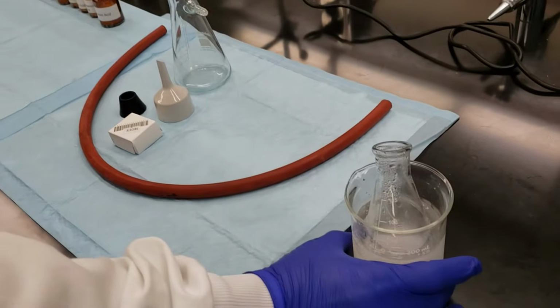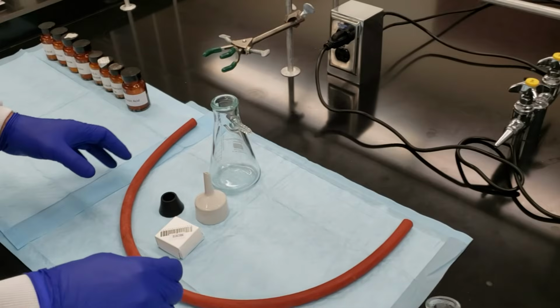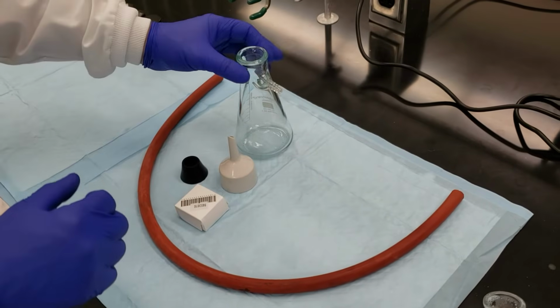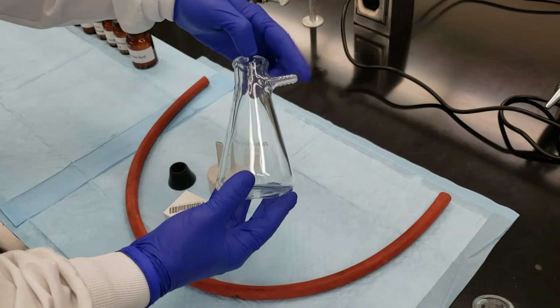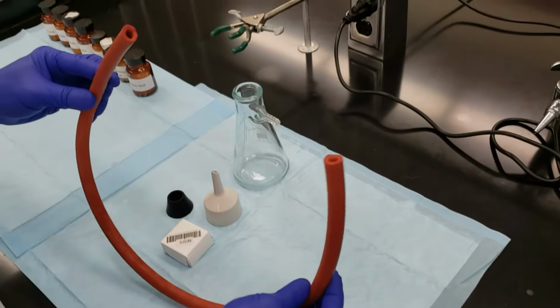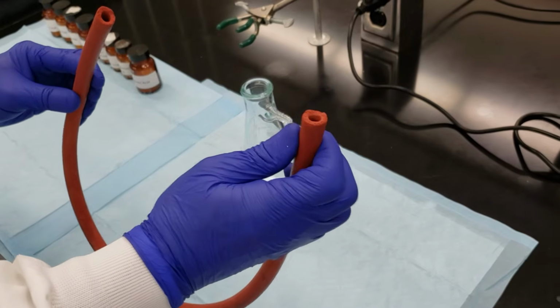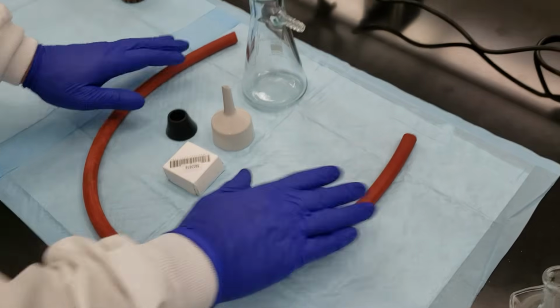As we're cooling down our flask with our crystals, we're going to go ahead and set up our suction filtration setup. This is the way that we're going to isolate our final recrystallized and purified crystalline compound. We're going to need a couple of things here. We've got our sidearm filter flask. We've got our thick rubber tubing. This is our vacuum hose, not to be mistaken with our water hose that we'll see in our distillation experiment. This is what we're going to use to hook to the vacuum.